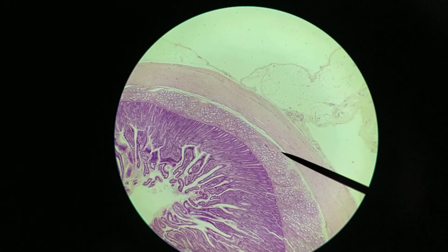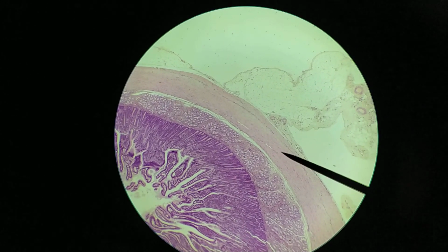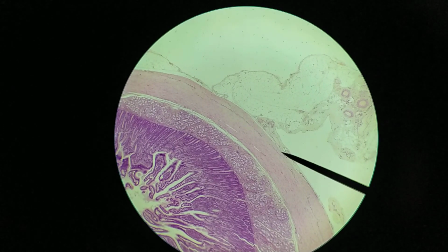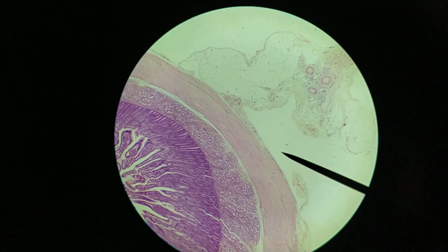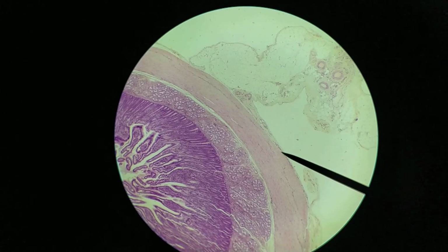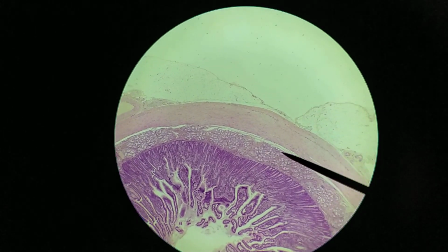Now beyond the submucosa, we have a layer of muscle, or two layers of muscle. This is the tunica muscularis, and what we have is an inner circular layer of smooth muscle, and then an outer longitudinal layer of smooth muscle. Okay, so let's take a look around the outside. Notice that there is a free surface here. There doesn't seem to be a lot of connective tissue around the outside, just a free surface for the most part along the outside of this structure in general. And so what we have here is the tunica serosa on the outside.